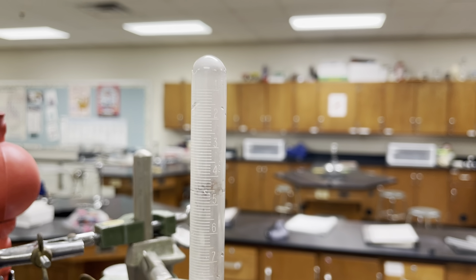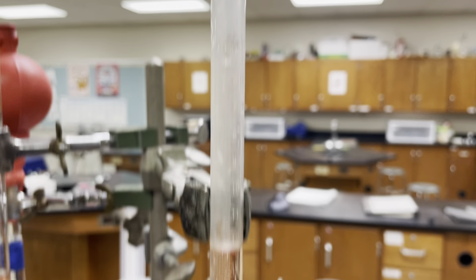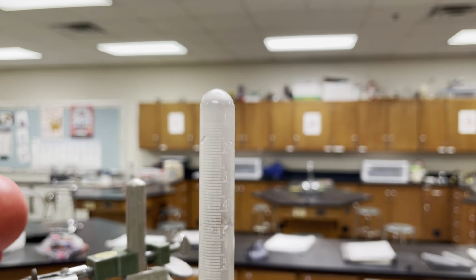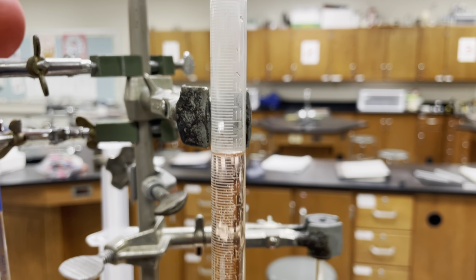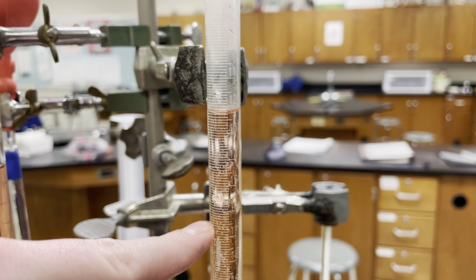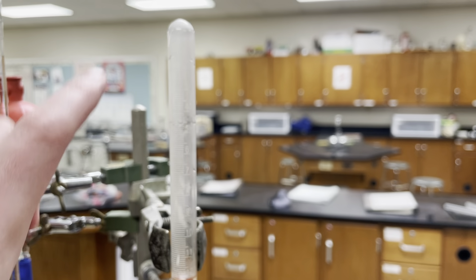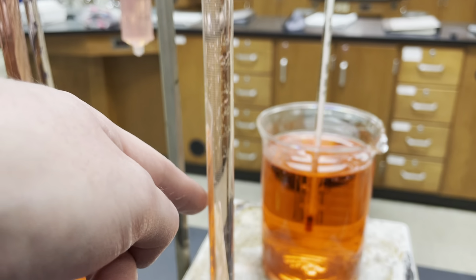In this case, because our air is at the top, or whatever gas you capture is at the top, and your liquid's down at the bottom, we don't really care about the volume of the liquid, we care about the volume of the gas in here. It would make more sense to measure the volume of the gas that you collect going downwards. If you were to have more gas, it would fill up going down this way and keep pushing more liquid out. And if you had less gas, it would be up here. So it wouldn't really make sense to make the highest numbers at the top. We want to have the highest numbers at the bottom, where we have more and more gas pushing the liquid out.